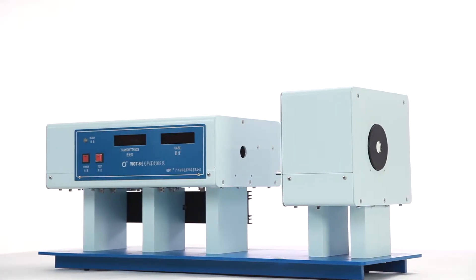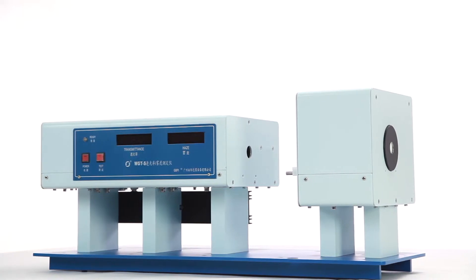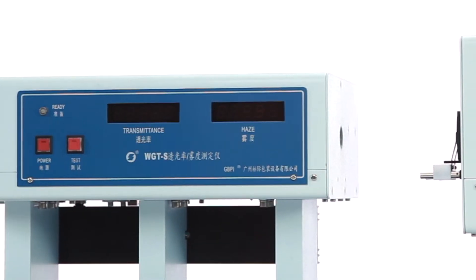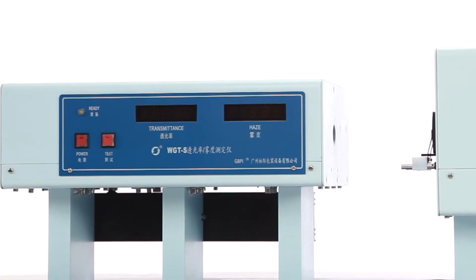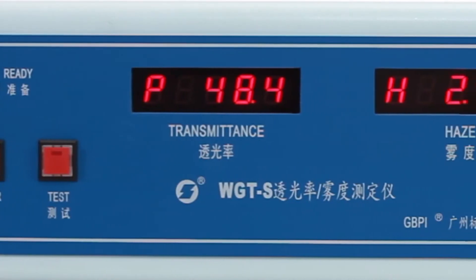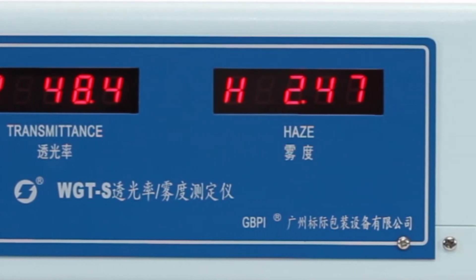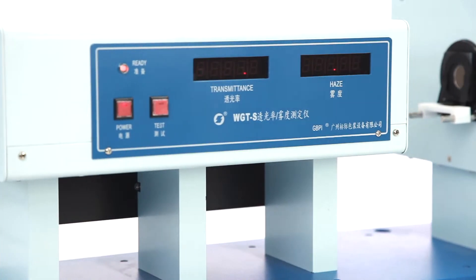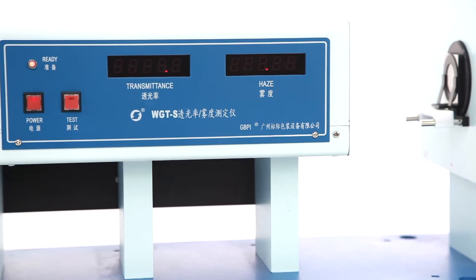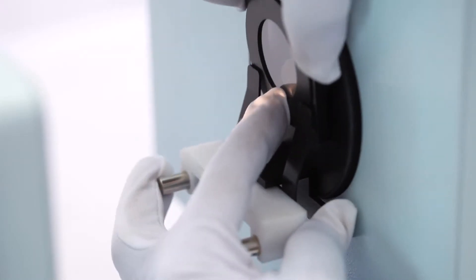The WGT-S light transmittance and haze tester tests the light transmittance and haze degree of all transparent and semi-transparent parallel plane samples — plastic plates, sheets, etc. — and tests the turbidity or clarity of liquid samples such as water and drinks, used across various industries.